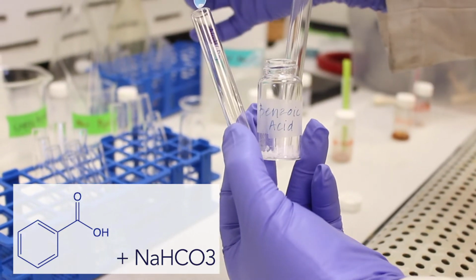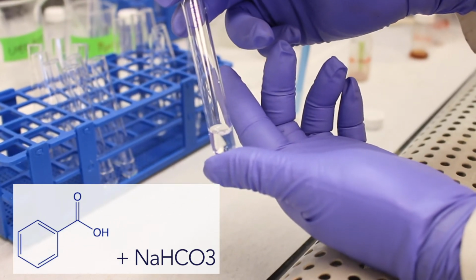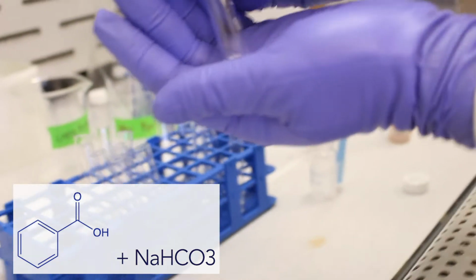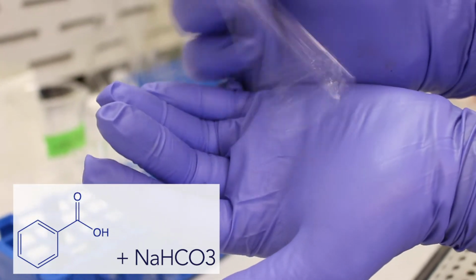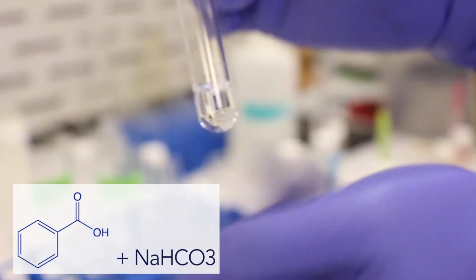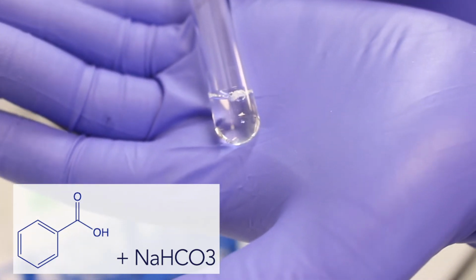Okay, so add a few crystals. And another thing to look for when you put acids into sodium bicarbonate is if they have bubbles. When sodium bicarbonate reacts with acids, it usually generates carbon dioxide. So look for that. Okay. This one is kind of hard to tell, but you can see some bubbles, very tiny bubbles, surrounding the crystals of benzoic acid.